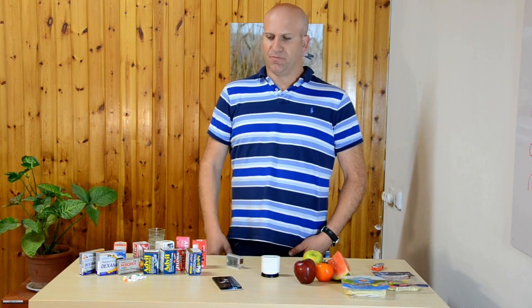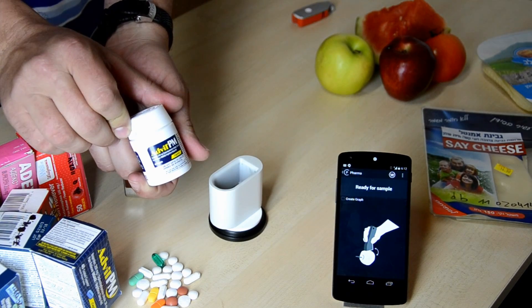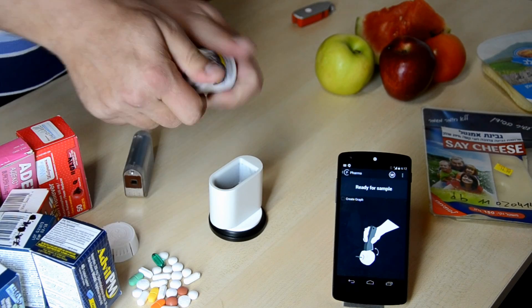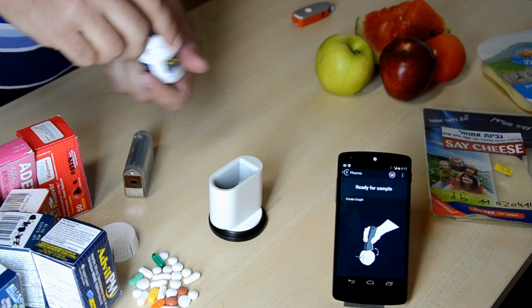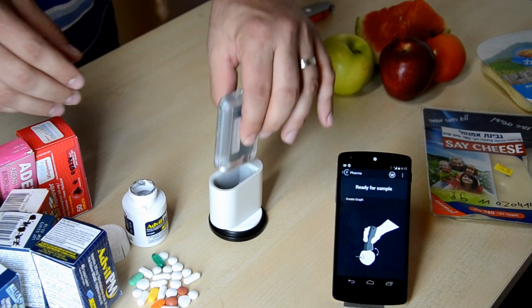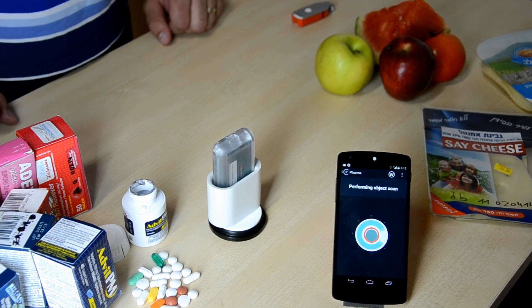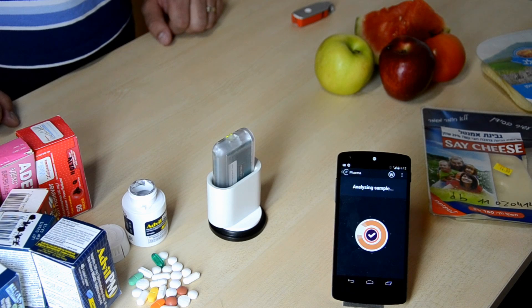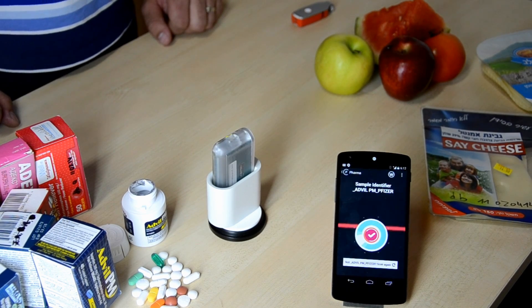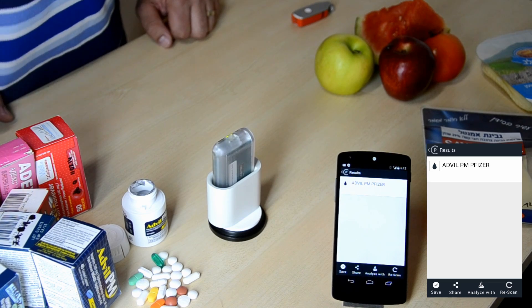Now I'm going to show how we can use our device to identify pills. Let's take one pill for example. This is Advil PM. I open the case and take out the pill, place one inside and then use our device to identify the pill. I simply tap on the cell phone, it takes about two seconds to measure, and we get the identification on the screen. As you can see, I identified it as Advil PM of Pfizer.